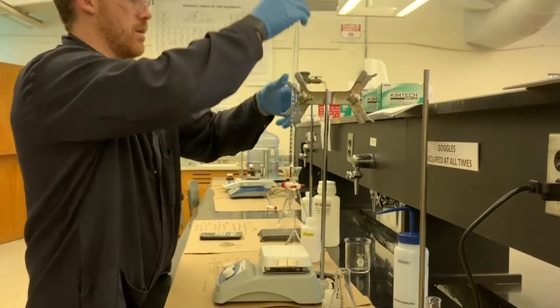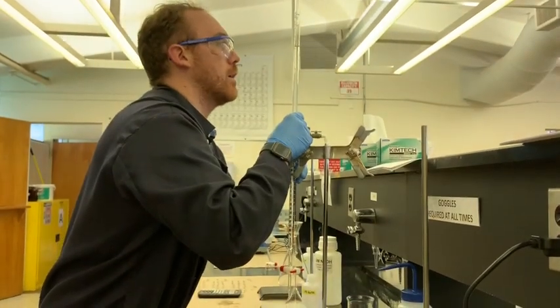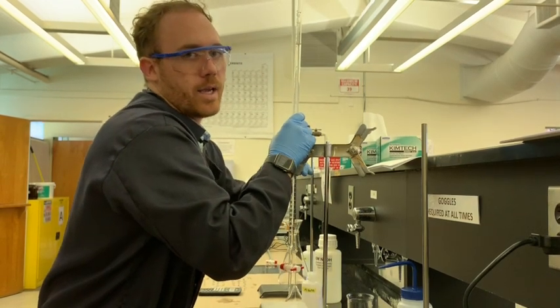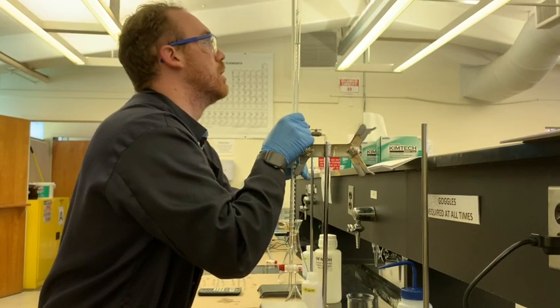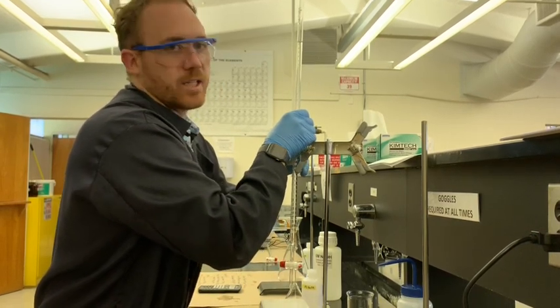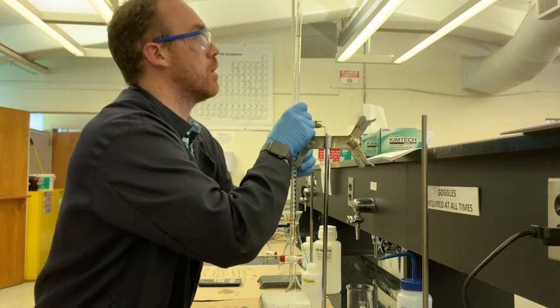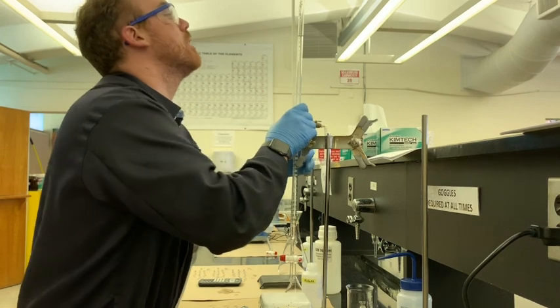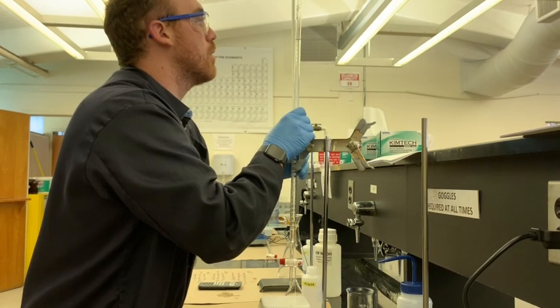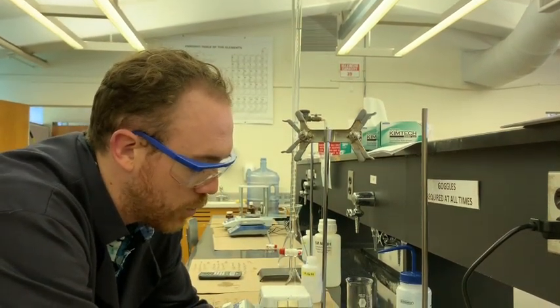So what you'll do first, once you've removed the bubble, is you will take the first reading. You want to make sure that you're always reading to 1/100th of a milliliter in this case. For this particular burette, that's what it's calibrated to. It's calibrated for plus or minus 0.10 milliliters. So you can expect it could be 0.1 milliliters over or under whatever your reading is, but you want to make sure you collect all of those significant figures if you can. So that's going to leave us with 4.20 as our first reading for our starting volume, 4.20 milliliters.